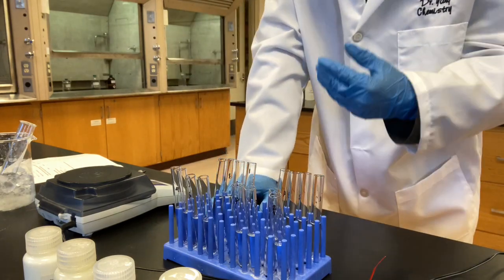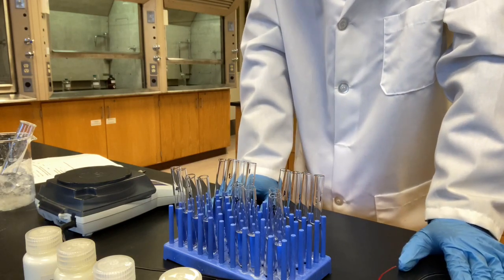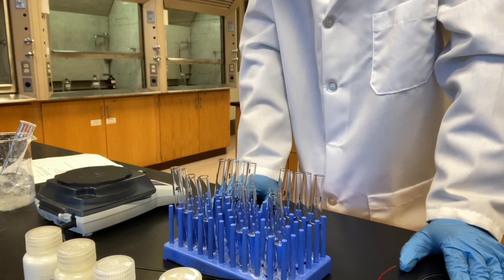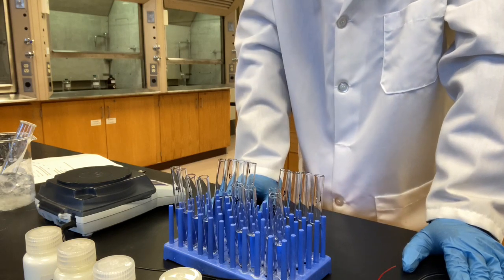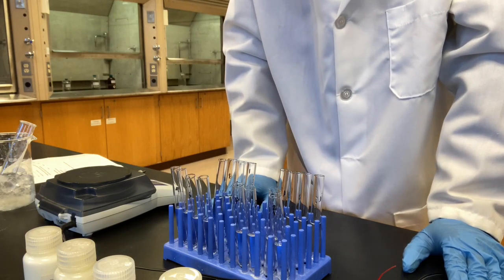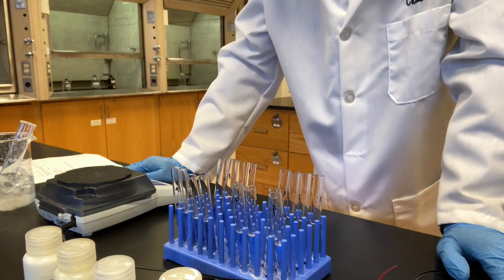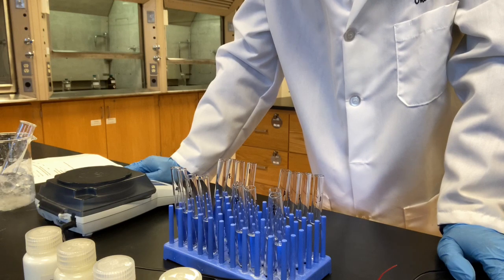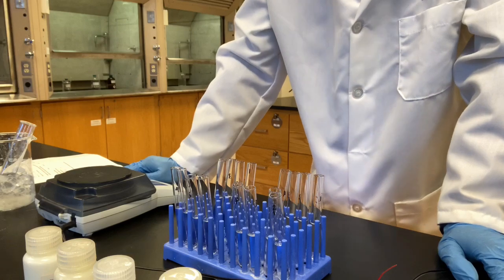If the sodium chloride all dissolves, we say it is soluble. If you see it clearly dissolved some, but not all of it is gone, that is slightly soluble. And if it is so hard to tell, that is insoluble. So you're going to write either S for soluble, SS for slightly soluble, or I for insoluble in that table on the report sheet.